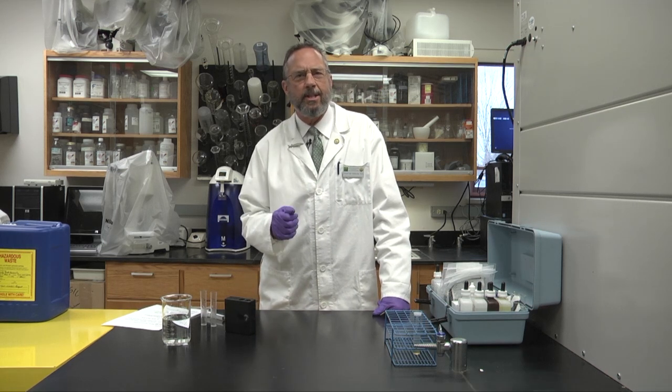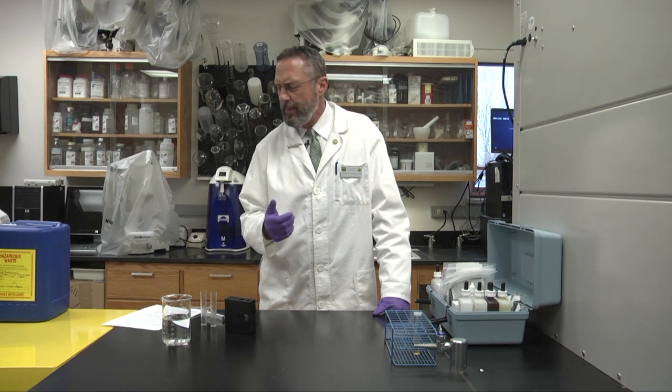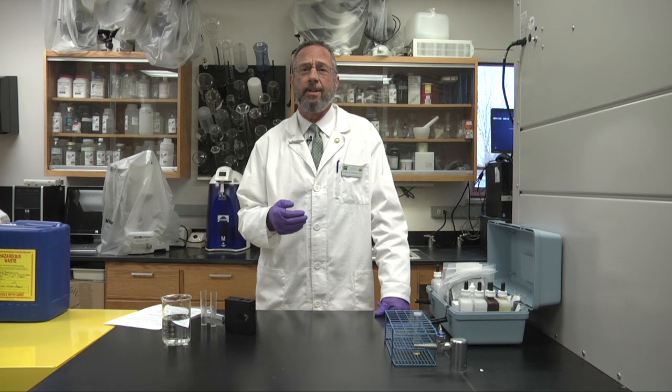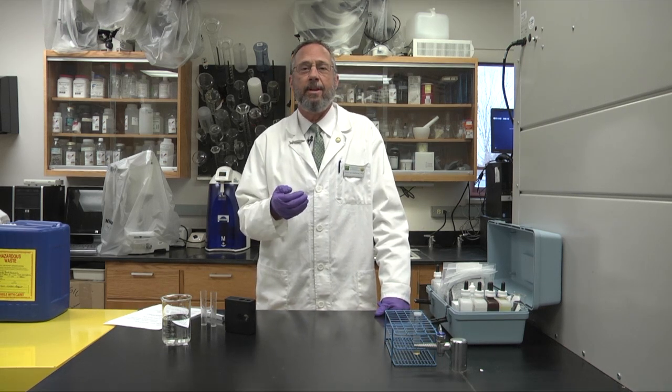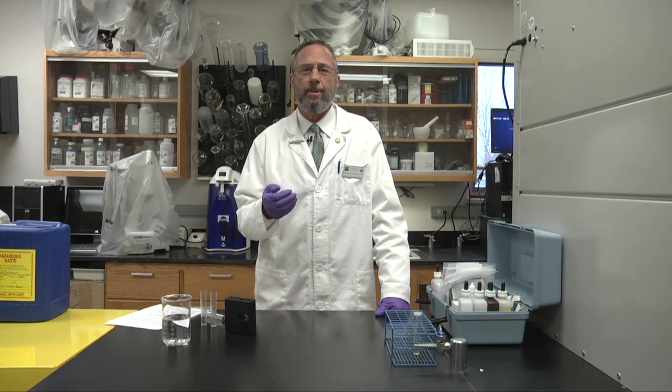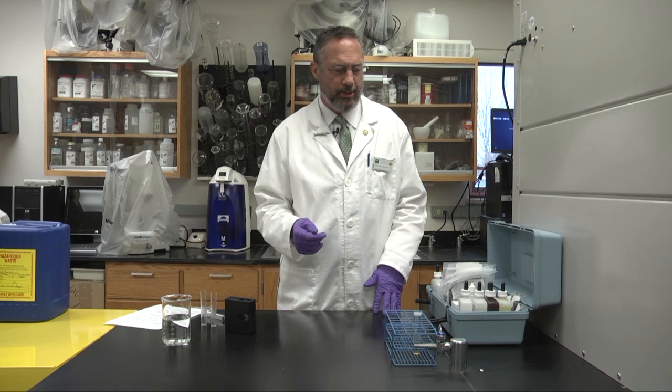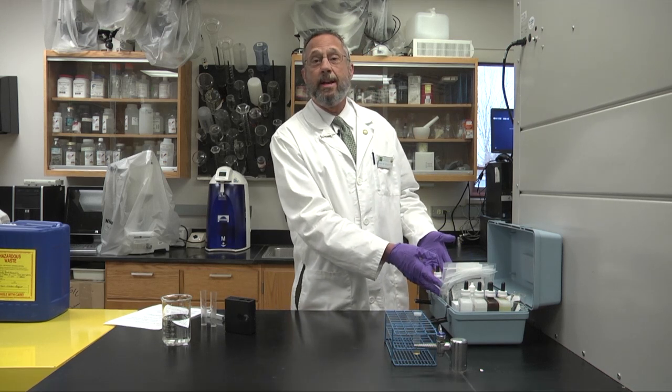With the tank systems, whenever you feed fish, there's an ammonia buildup and the ammonia has to be checked and monitored or it can be toxic to the fish. The ammonia breaks down to nitrite and that has to also be checked. So we'll be going through the actual testing procedures using this FF1 test kit here for ammonia and for nitrite.